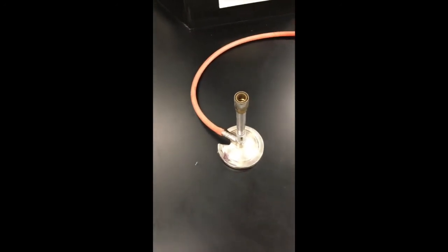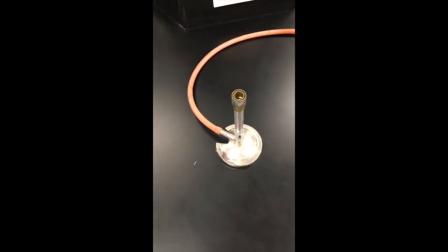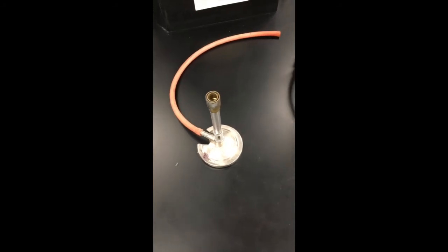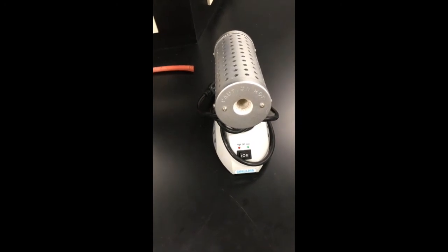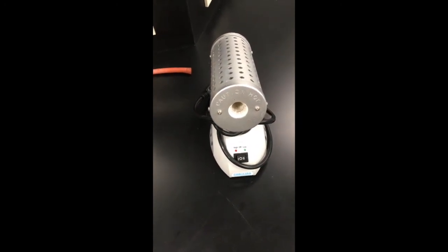Prior to use, this can be sterilized by holding the wire in the flame of a Bunsen burner until the wire turns red hot. In some labs where the flame is no longer used for safety reasons, an electric heater is used to flame the loop.